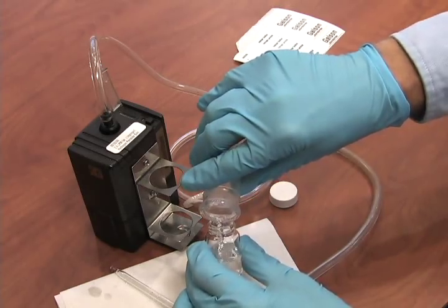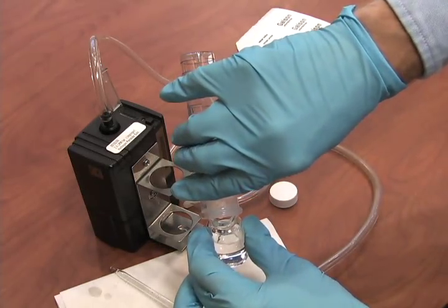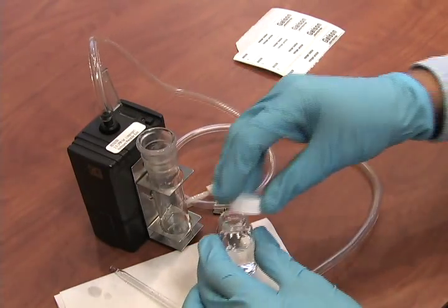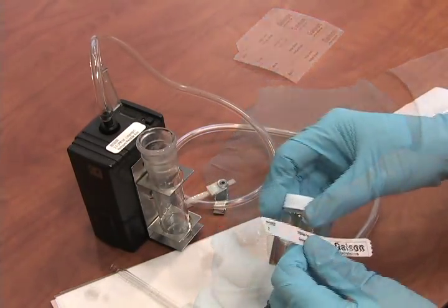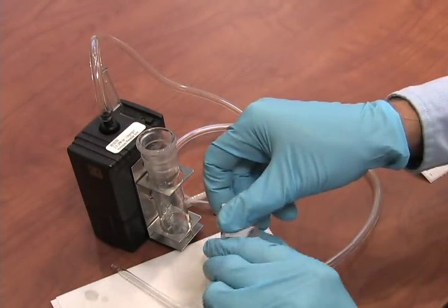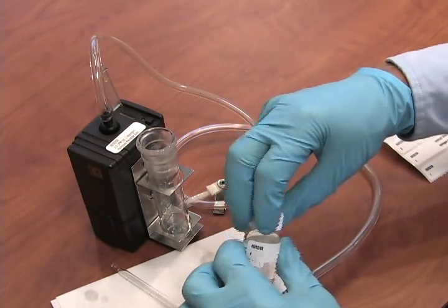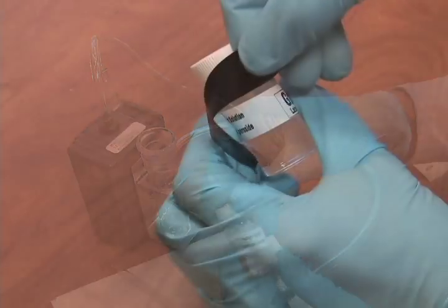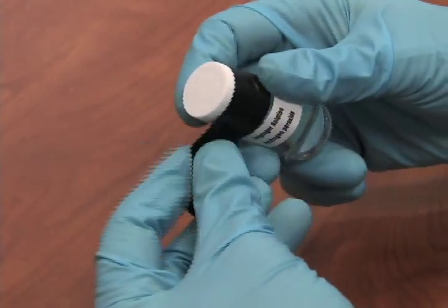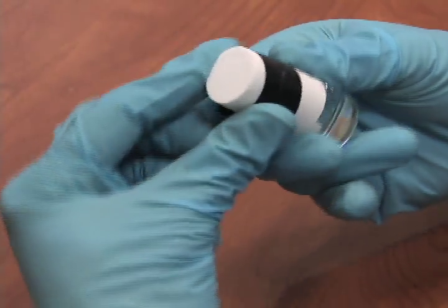After sampling is complete, turn off the pump, transfer the solution to a vial, and label the vial. Tighten the vial cap and apply tape to the cap in the same direction that you tightened it to prevent leakage during shipment.